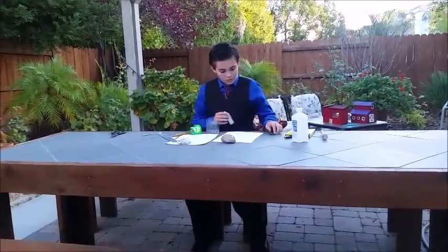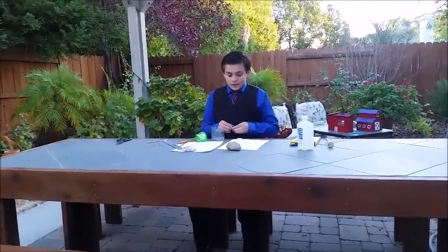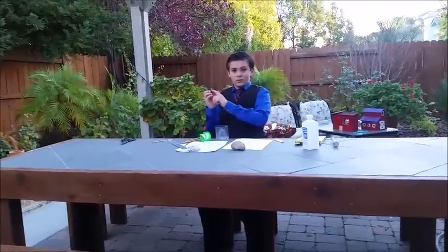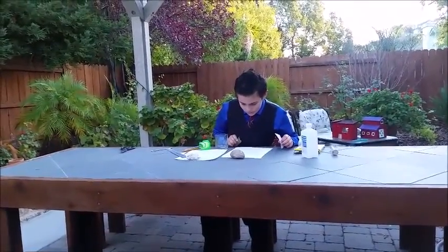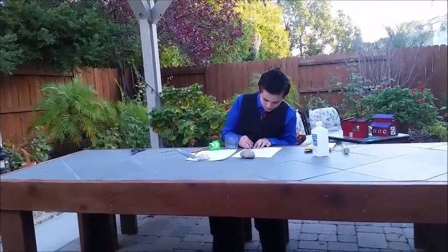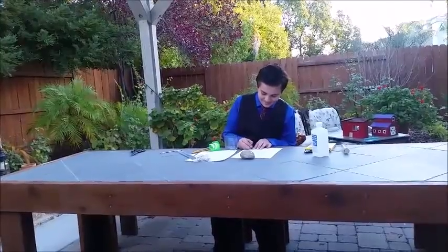What you're going to want to do is take a leaf and wrap it around the coin with the waxy side out. And you're going to want to rub the leaf on the line, like I'm doing.